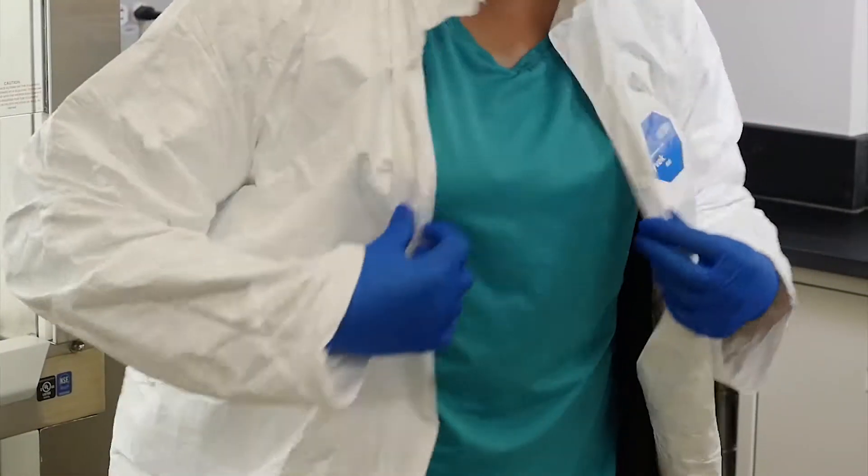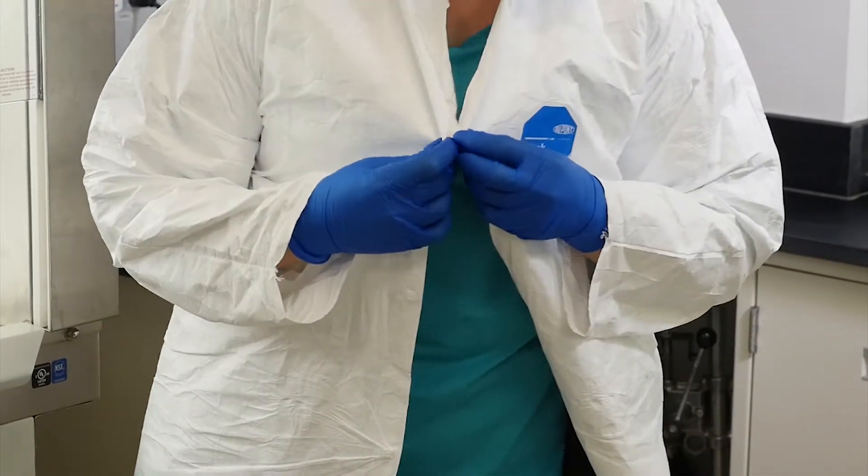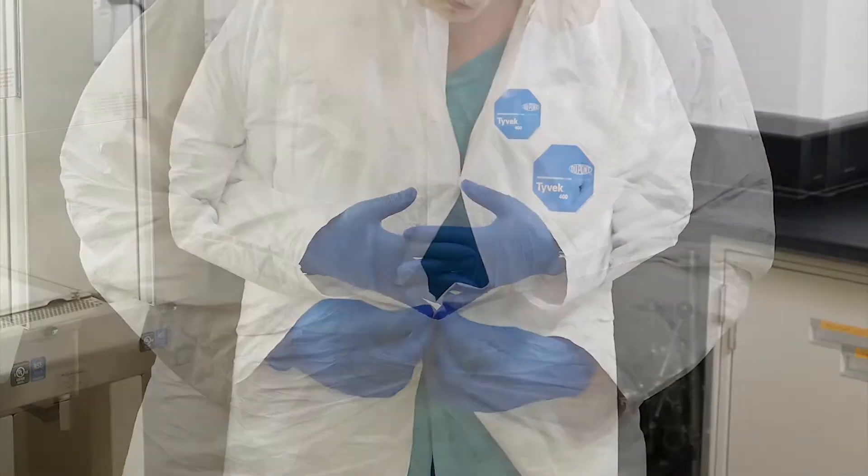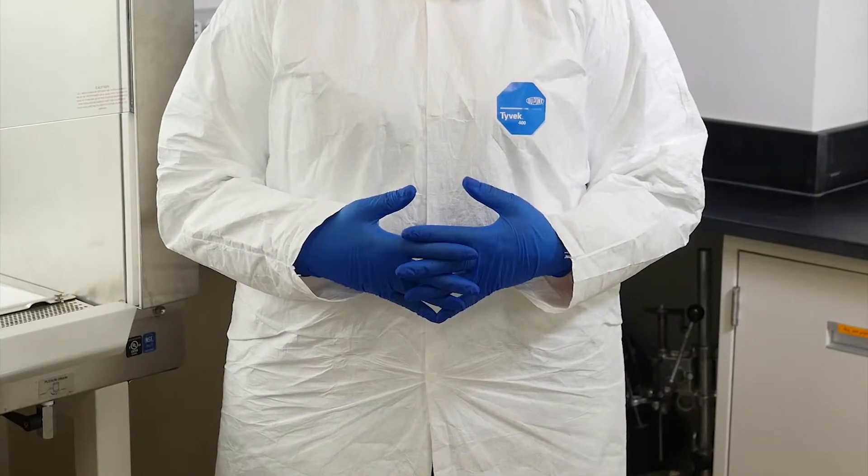Prior to preparing the workspace and working with your sample, put on your personal protective equipment, including gloves and a lab coat. Remember, your safety is first.